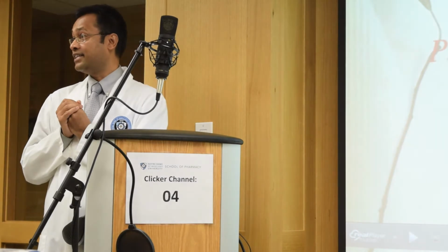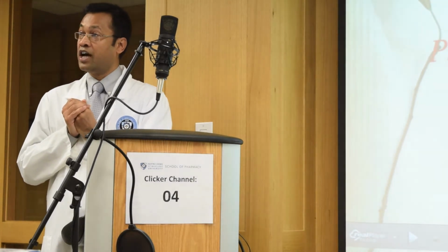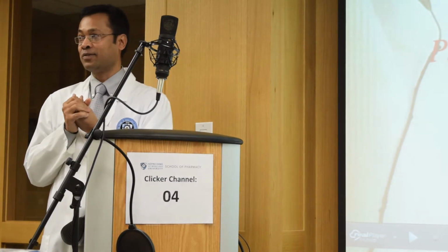The experiment that we're going to do is a eutectic mixture. Preparing a eutectic mixture. Does anyone have any idea what a eutectic mixture is? What is a eutectic mixture? Go ahead. Great, that's what it is.